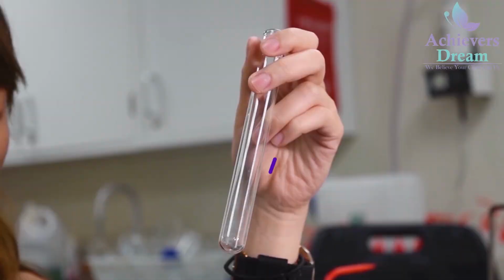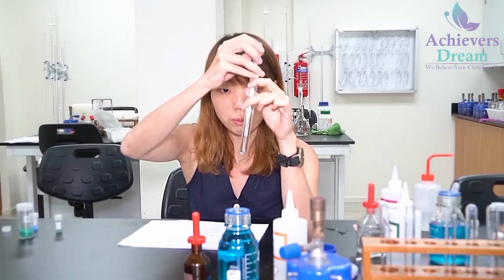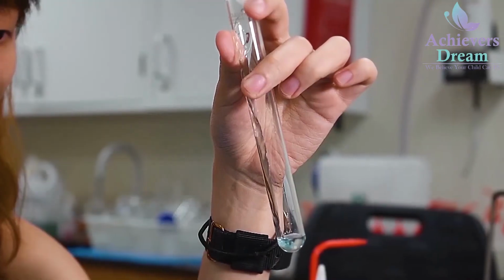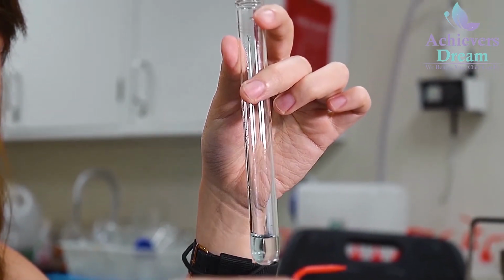Now I'm going to repeat the same thing for solution Q. So 1 cm cube of solution Q, followed by nitric acid, and silver nitrate.